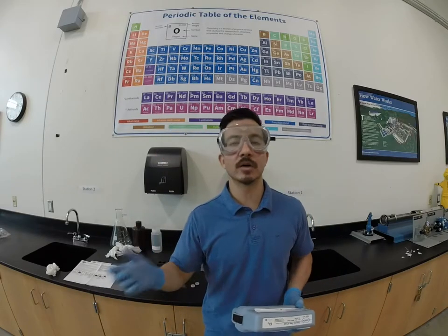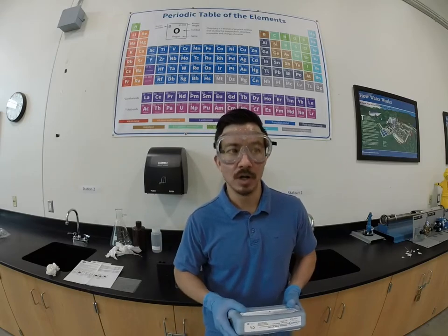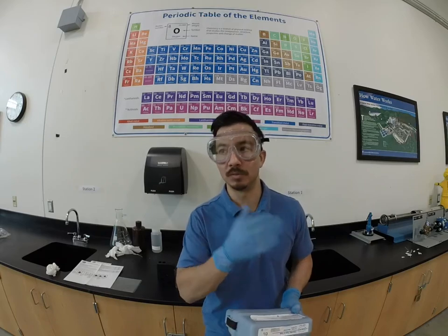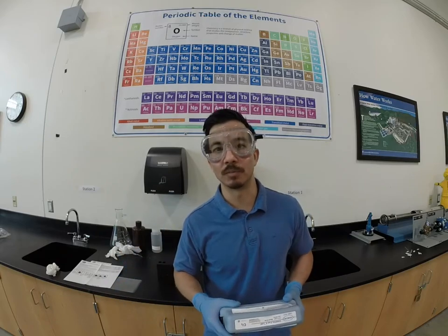In this video we are going to be taking a water sample and measuring the amount of free chlorine in that sample — the so-called chlorine residual. We're looking for a residual to be between 0.2 and 2 milligrams per liter, but absolutely no greater than 4 milligrams per liter.